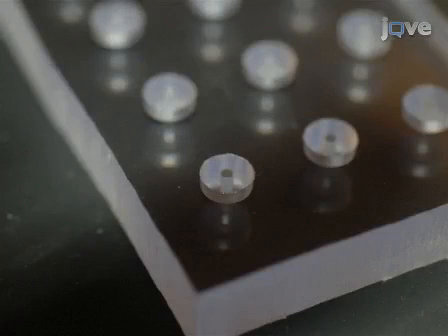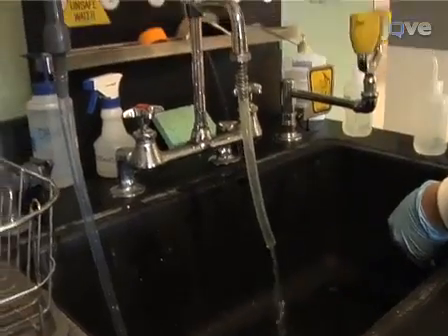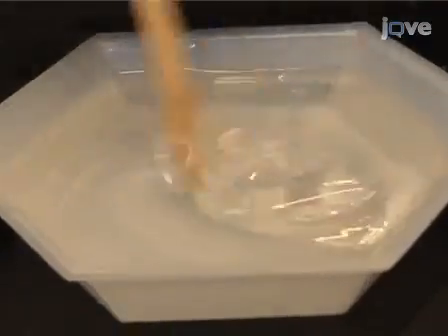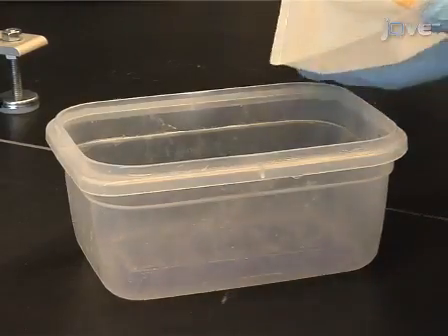Begin by milling a half-inch thick piece of polycarbonate to create 15 round-bottomed annular wells with a center post diameter of 2 mm. Clean the polycarbonate mold to remove any plastic debris generated from the milling process, and let the mold dry. Next, mix PDMS at a 10:1 ratio of base to curing agent. Degas the solution to remove all air bubbles, and then pour it into the polycarbonate mold.